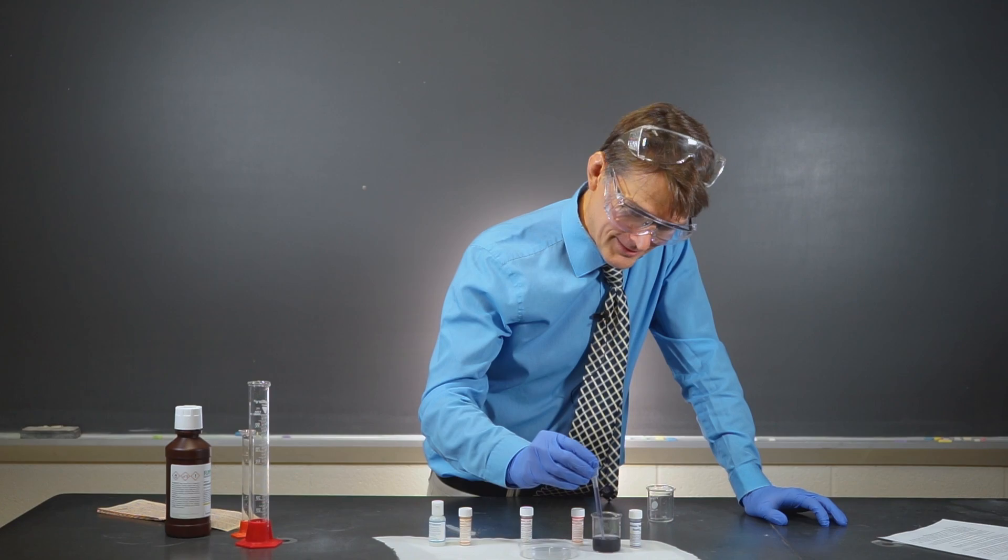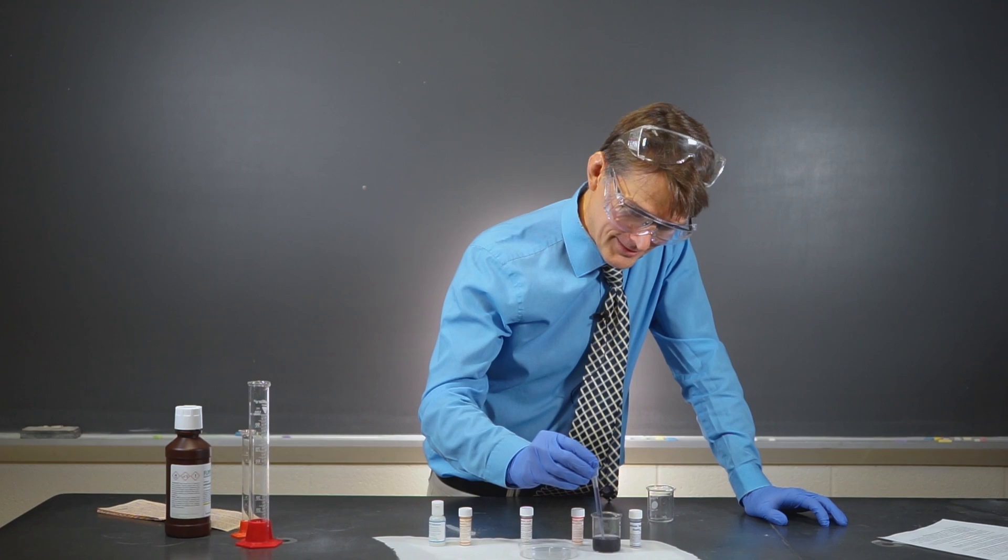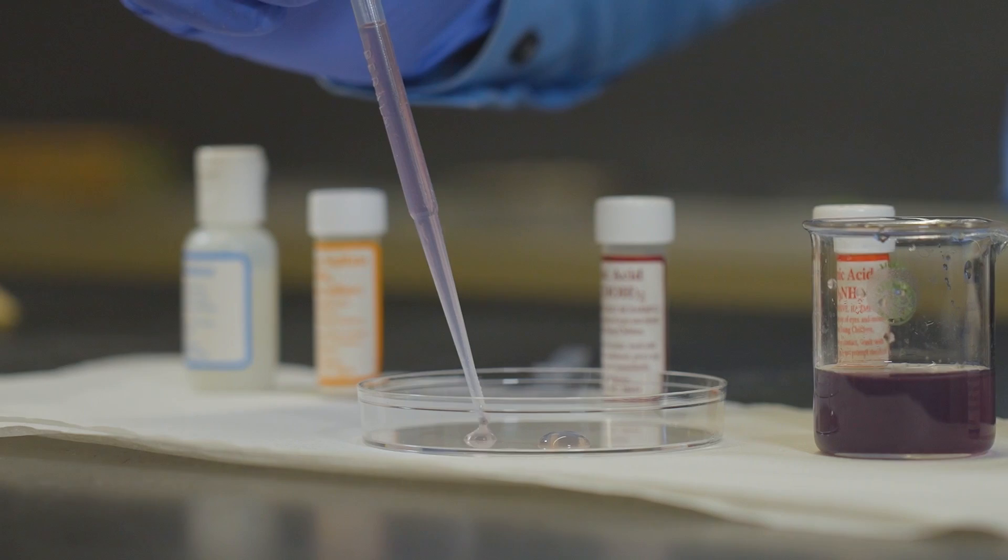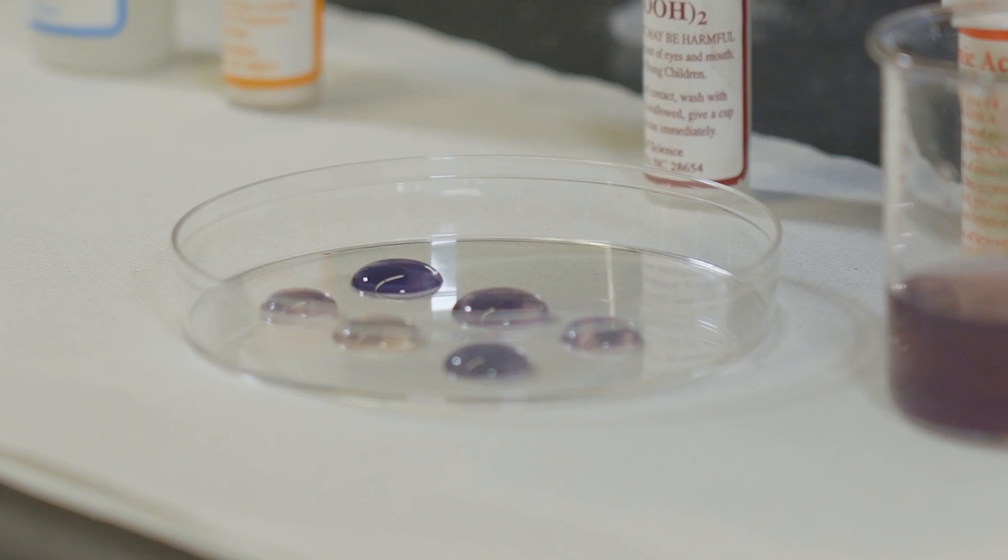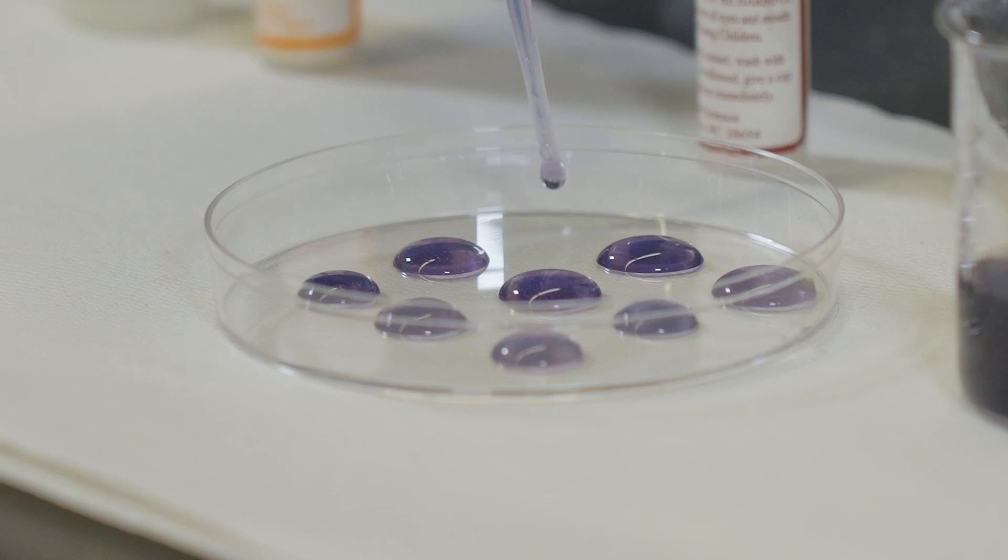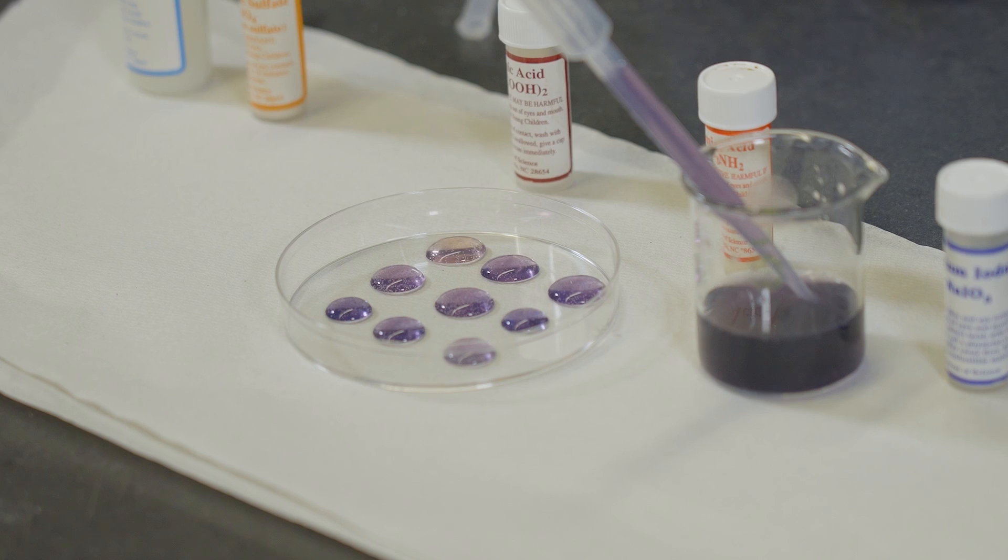Let's pull a little bit of this out. And I'm going to just put some drops here into this. Look at that. Even the individual drops are changing color. That is crazy. I love it. Now, again, how these work is really complicated. But still, if we delve into some of these oscillating chemical reactions, we can learn a little bit about how they behave and why the different colors are generated. Isn't that cool?